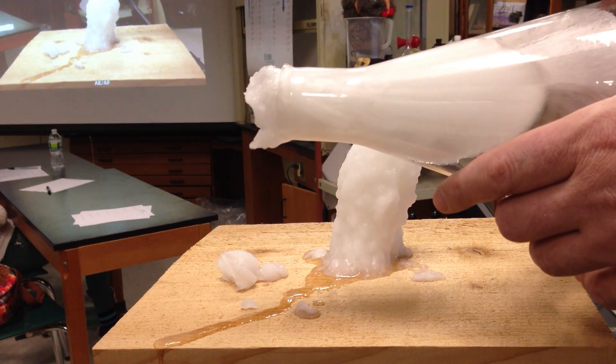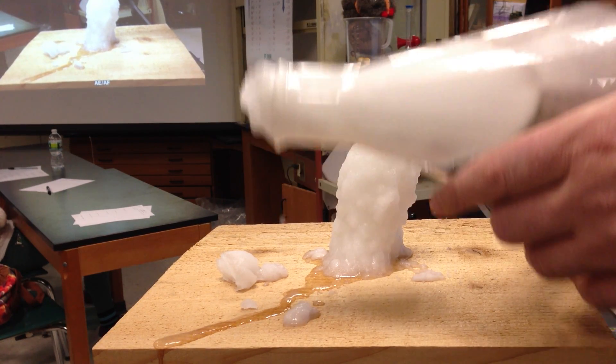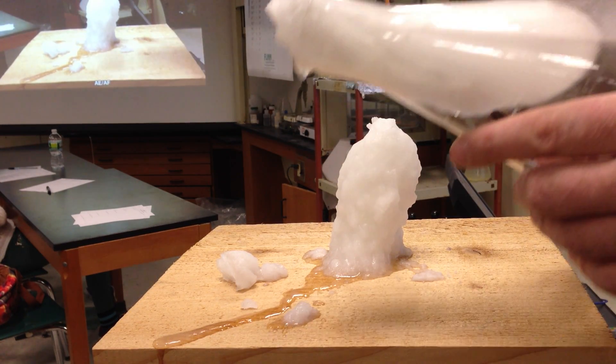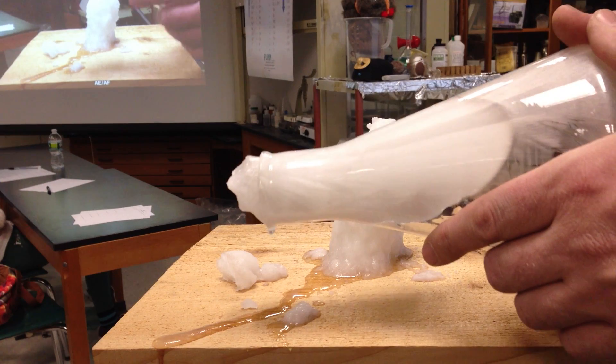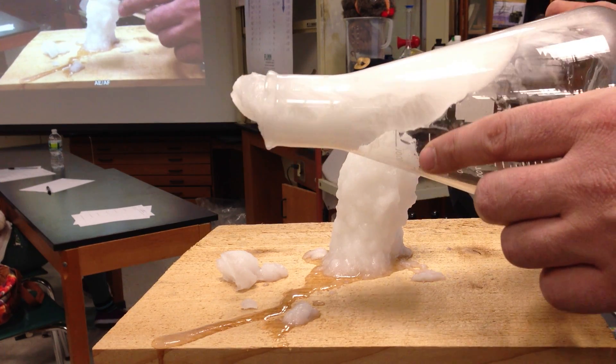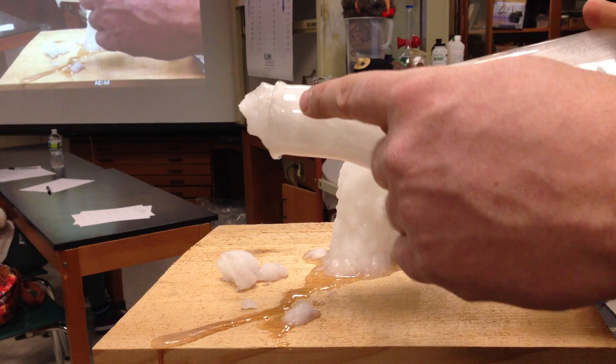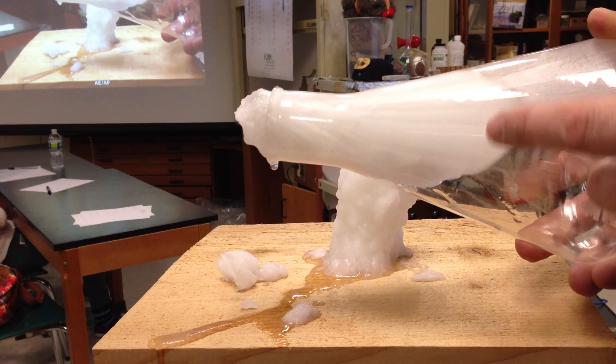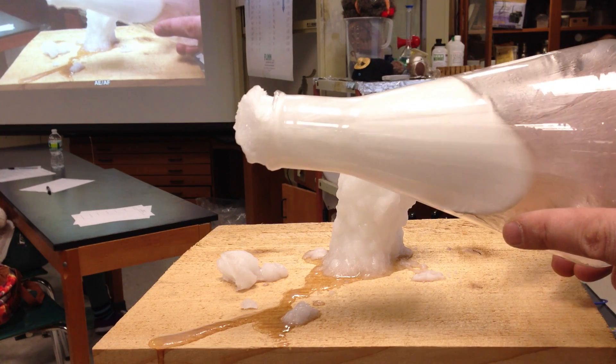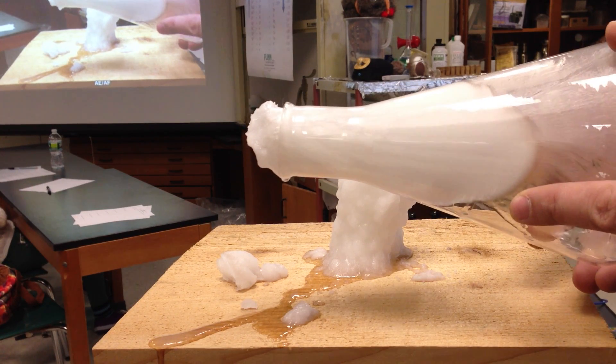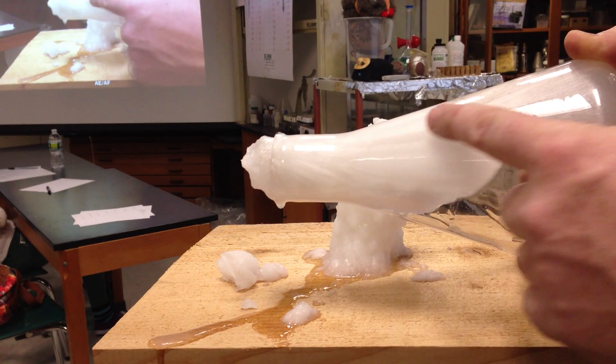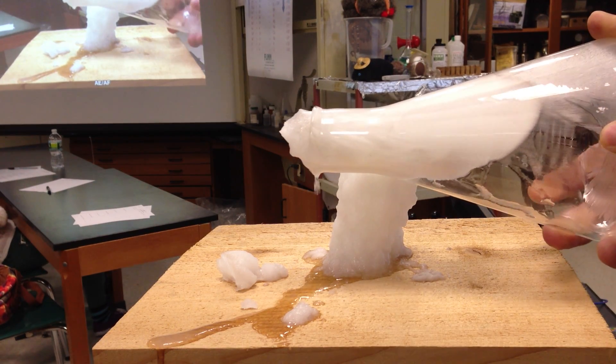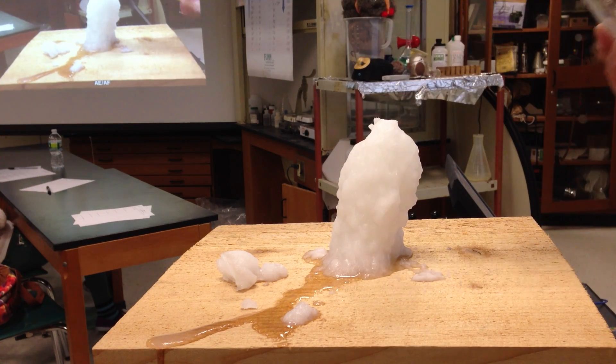And kind of cool, if you can see in the camera. You can see that the crystalline, you can see how the seed, it went out this way. Look carefully how the crystalline pattern went outwards. So you can see how the crystal formed once it had some organization and outward. It's a nice example of a supersaturated solution coming out and precipitating into a solid.